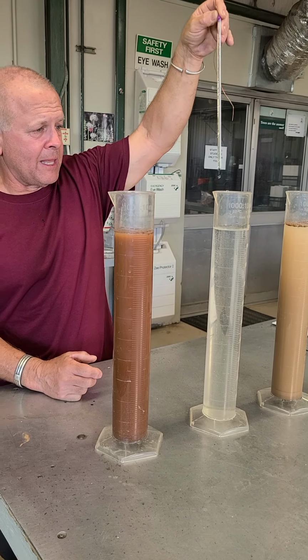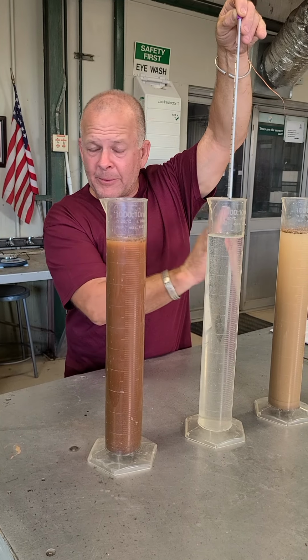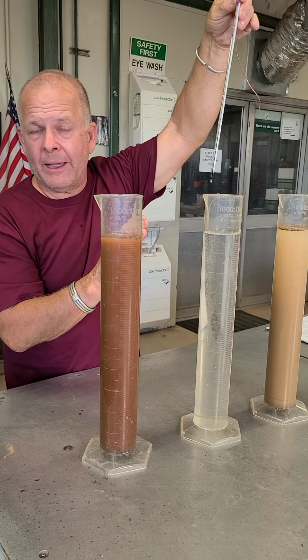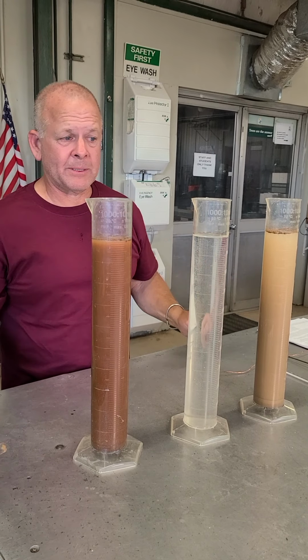You'll see that in the end there, but this temperature here is going to represent the temperature of everything, because remember, everything's been sitting and equilibrating in this room for a long time. The samples have been running for like a week now, right? Since the last video we did. So we've got plenty of time for them to all be the same temperature.